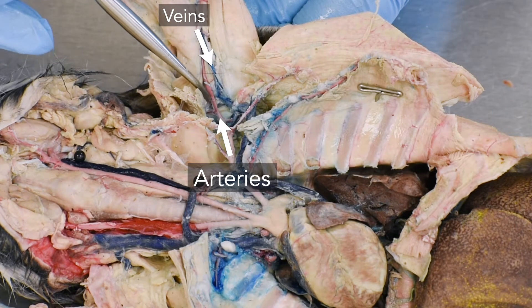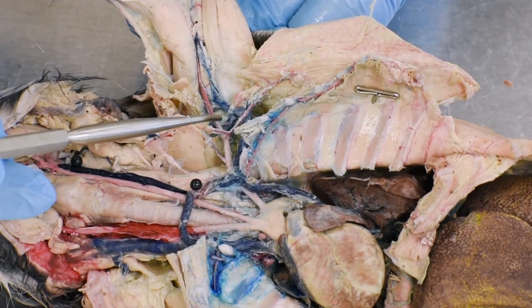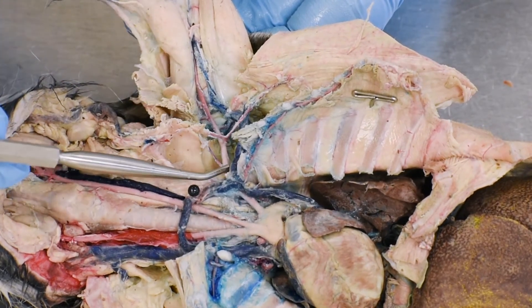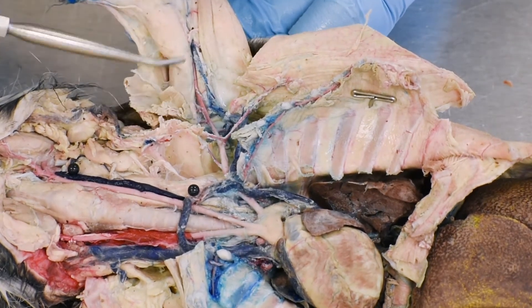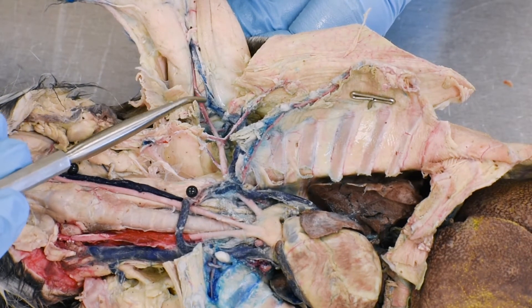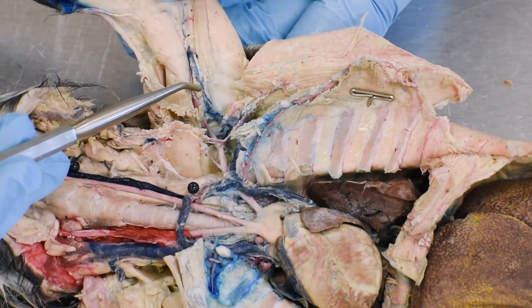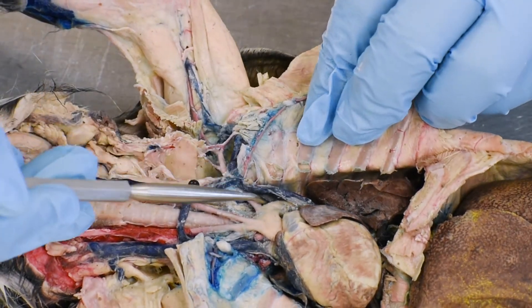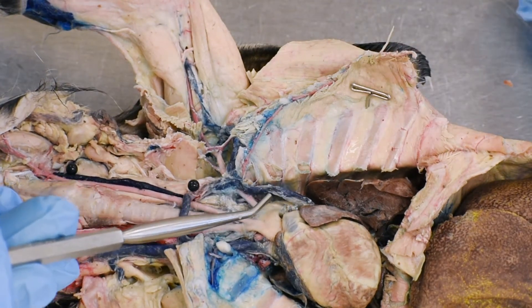The axillary will be continuous as the brachial artery. It is the same artery, but depending on the region it is passing through, the name changes — first subclavian, then axillary, and then brachial. For the brachial section, we can also see the brachial vein returning blood back to the heart. From the brachial vein, gradually we will follow the subclavian merging into the superior vena cava — this is the left superior vena cava.